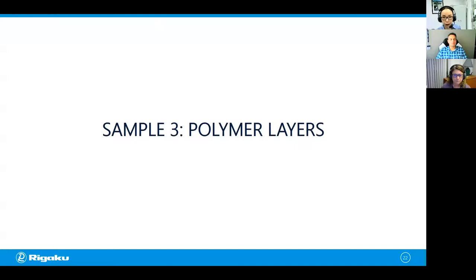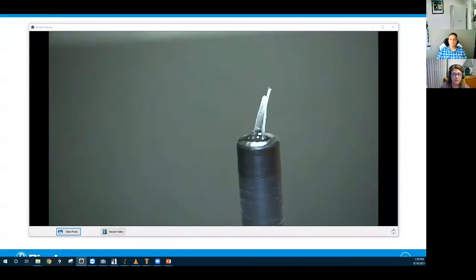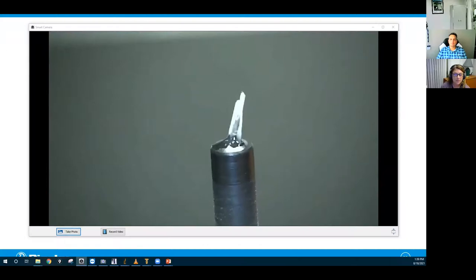Okay, so this is the next sample. We're going to be looking at a polymer layered sample. So I'm going to launch the poll here, and while I get the sample ready and show it to you, this sample is a layer of parafilm and UV resin. I want you to select the X-ray energy that differentiates the parafilm and UV resin best. Would you say that's copper radiation or moly? Copper is 8 keV, moly again, 17 keV. And you can sort of see the layers here in the sample view image that I'm showing to us.